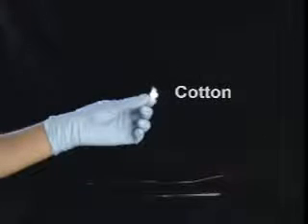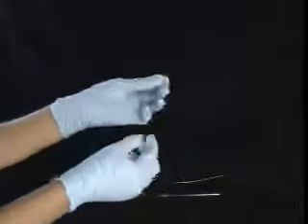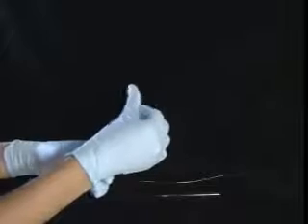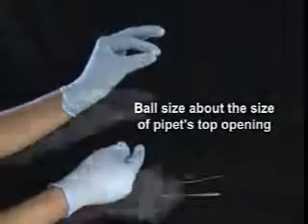Here's a piece of cotton. Break off a small bit. Roll this into a small ball. The ball should be about the size of the top opening of the pipette.